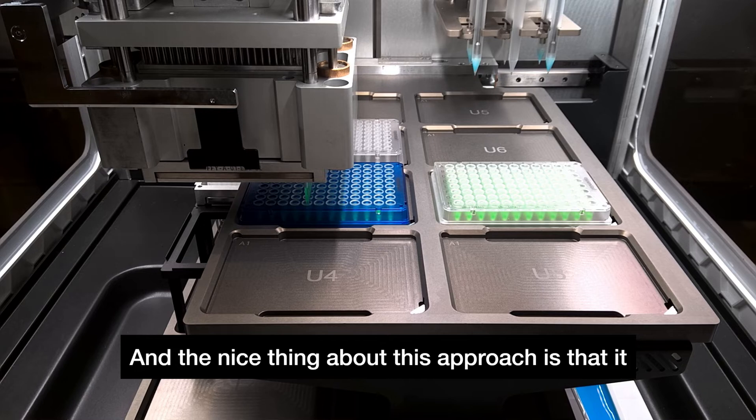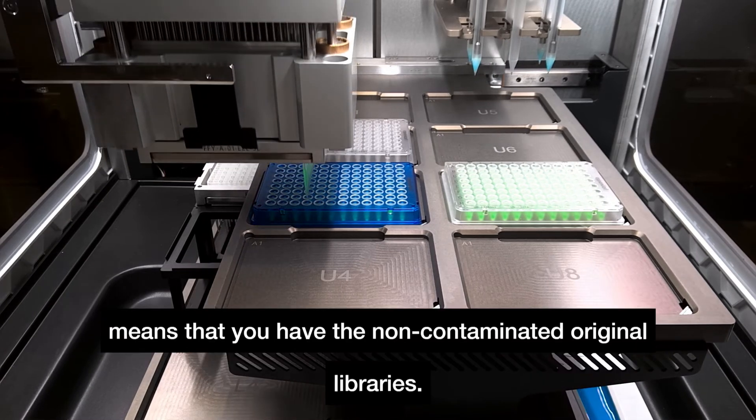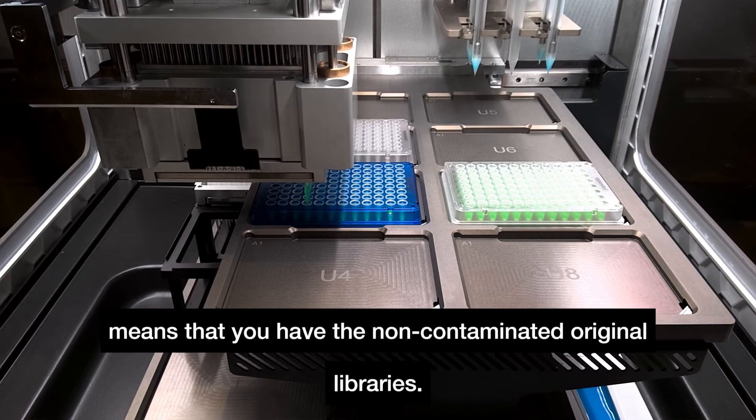The nice thing about this approach is that you have non-contaminated original libraries.